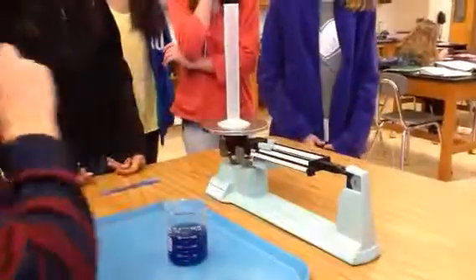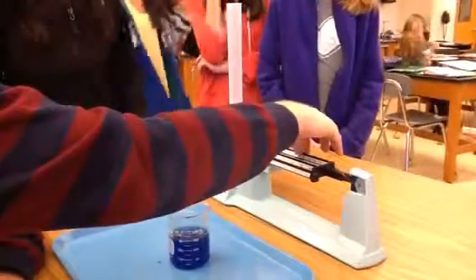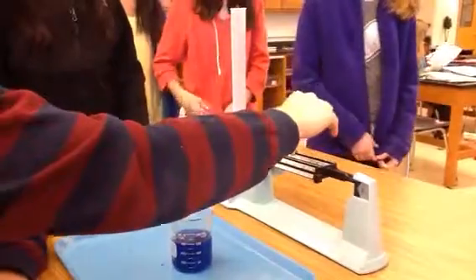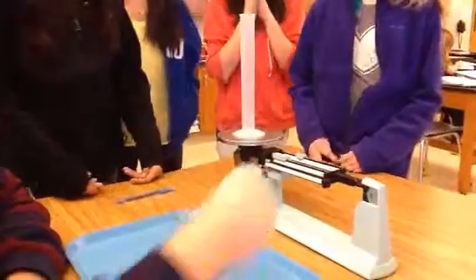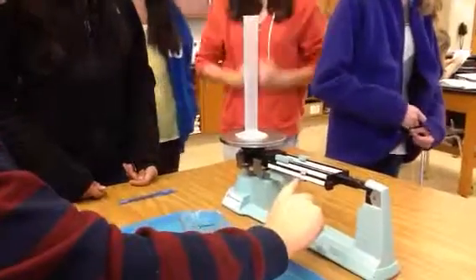So now we have to measure how heavy the empty cylinder is. I'm going to skip a few corners here because I know what it should be about. If it's at 40 now, what do I have to do? It went down, so move it back one. So we're at 30, right? So we have to go this way a little bit, actually a lot.